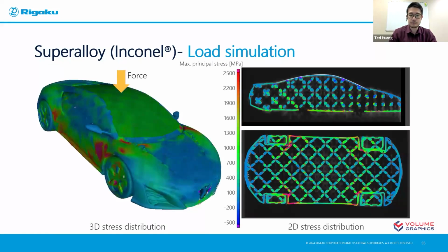This is the 3D stress distribution of the maximum principal stress. The red means there's more tension, and the blue means there's less tension or even some compression force. You can see already highlighted, there are some high tension areas near the wheel of this toy car. So in this case, you can immediately answer a question like, is this surpassing the material property of the Inconel? Well, in this case, obviously it didn't. But with this, you will be able to modify the product, maybe increase the thickness, maybe change the distribution of the struts inside, and then you can move on to your next iteration that improves your additive manufacturing product.